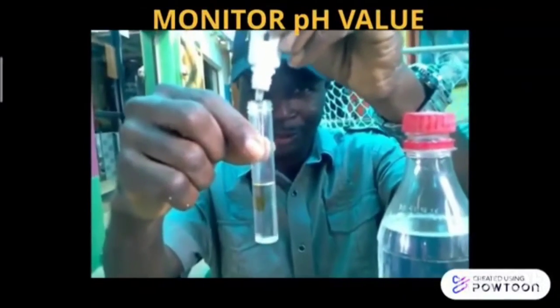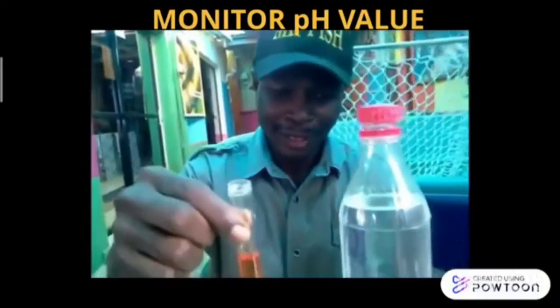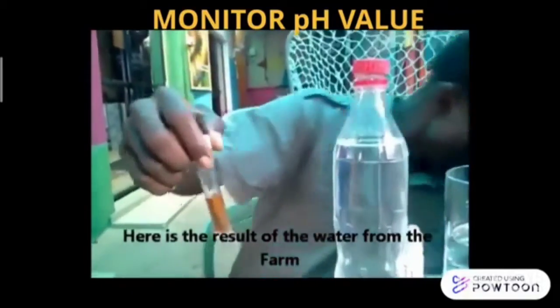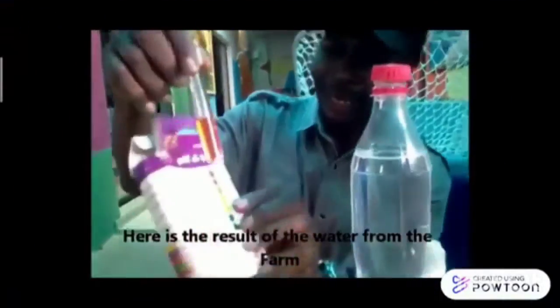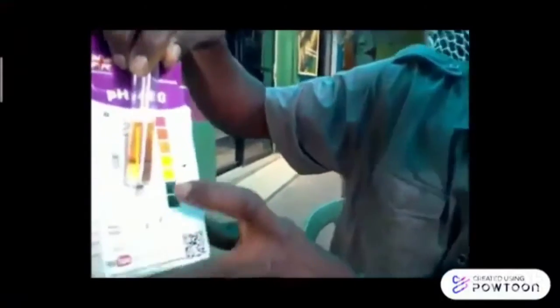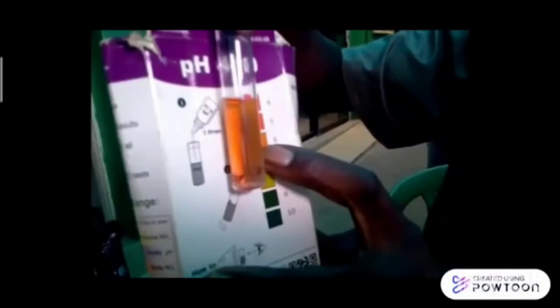To monitor the pH level, take a water sample from the fish ponds by using a bottle or container. Then, prepare a pH testing kit. The kit usually includes a number and color of liquid indicator. Add a few drops of this liquid into the water sample, then compare with the color indicator that comes with the kit.